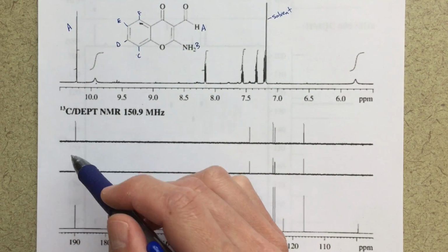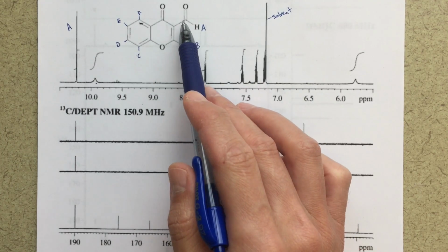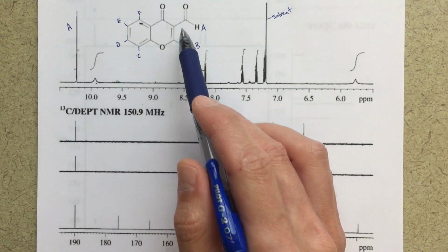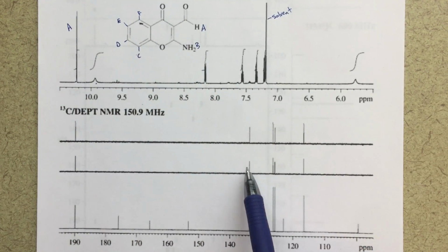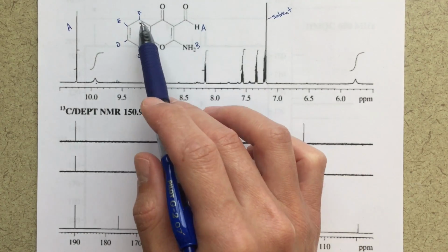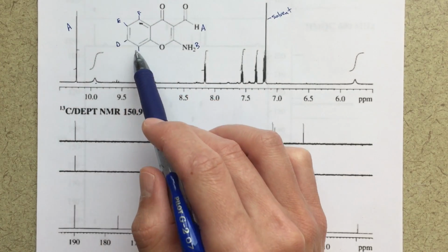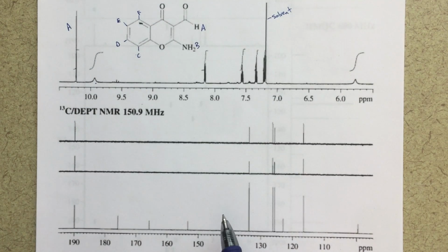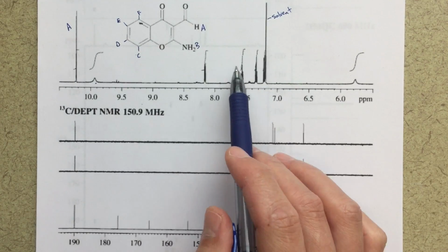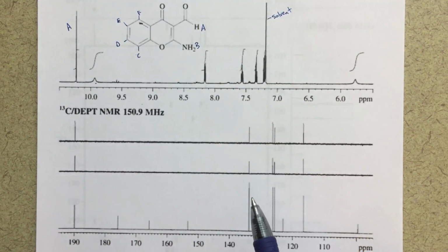Simply because that's where the carbons for an aldehyde are going to be. So this carbon here, I can tell is this signal, and this DEPT is telling me that these carbons, 1, 2, 3, 4, 5, are the carbons that have protons attached to them. So then these 4 signals here must be the carbons in my aromatic ring bonded to F, E, D, and C. That's what this is telling us. But eventually, we're going to be able to assign all of these signals to the different carbons and protons in my structure.